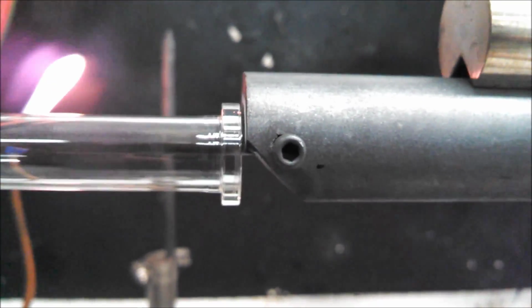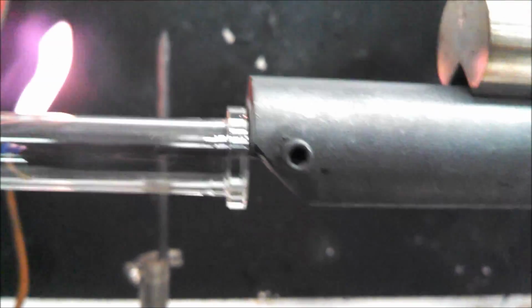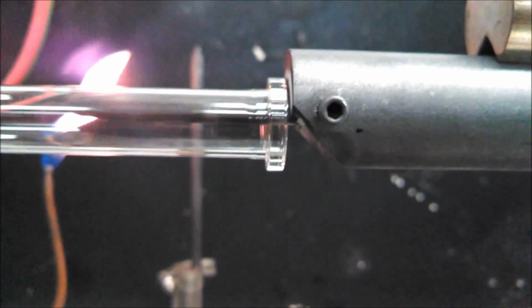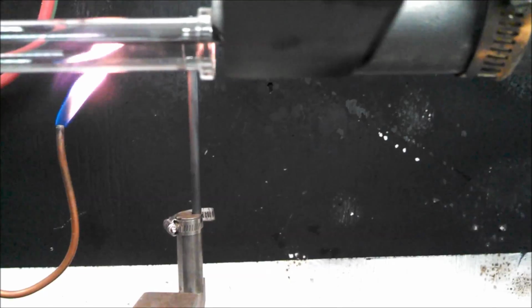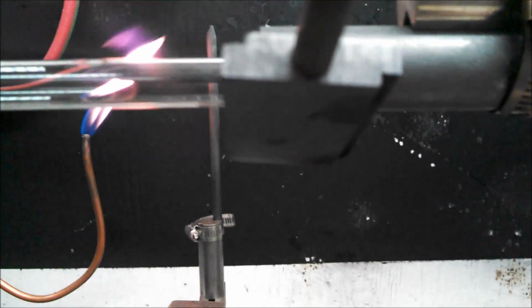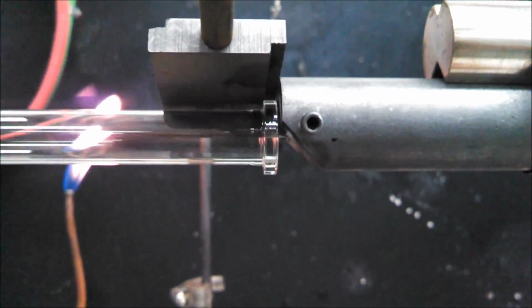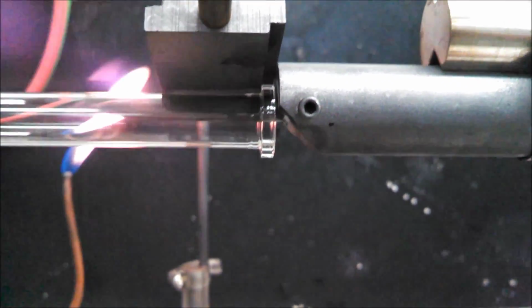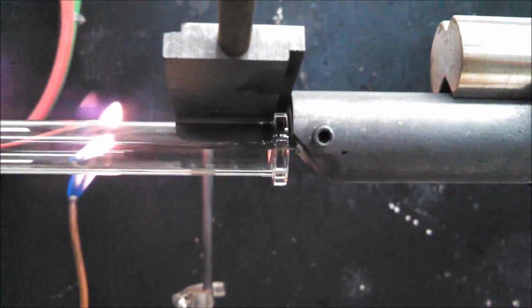Excellent. It got a little messed up on the left there, but I was reaching over a guy's arm. But if you notice, let's see if I can do this again here. See the gap on the paddle? That rests up against the paddle or the rod on the right. And then you keep on bringing your tailstock in, and the glass gathers into the crack.